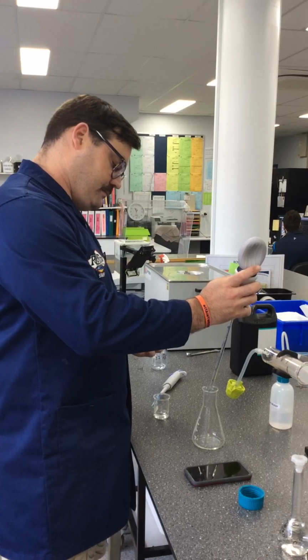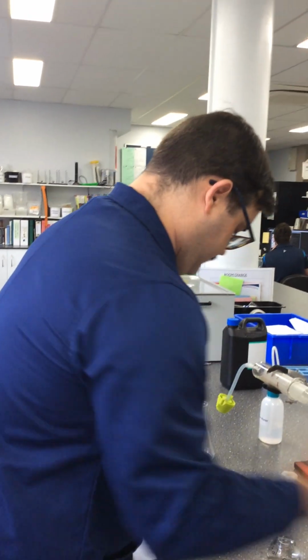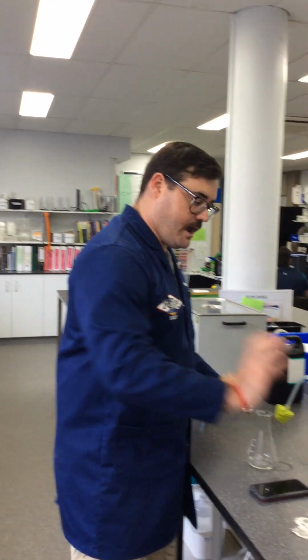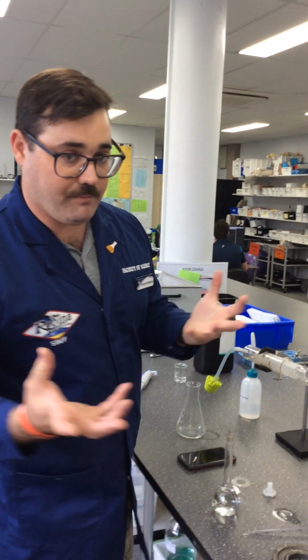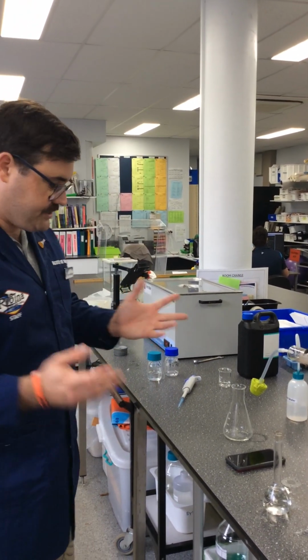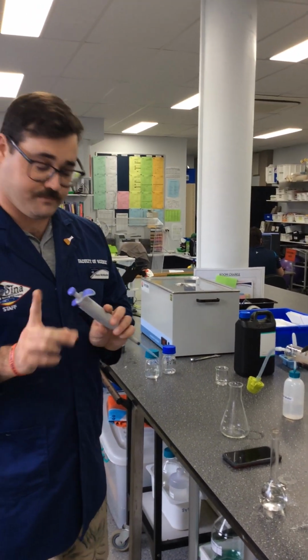Keep in mind that you'd be well practiced at this. Okay, we touch it to the side there. Make sure we put the lid back on so that we're not spilling anything. Okay, and we've got our 1% Catalase here. So remember, it all happens pretty quick, and this is why having people in your group helps. You can have one person on the Catalase, one person putting the lid down, one person on the timer, etc. Okay, so it'll run a bit more smoothly for you guys.